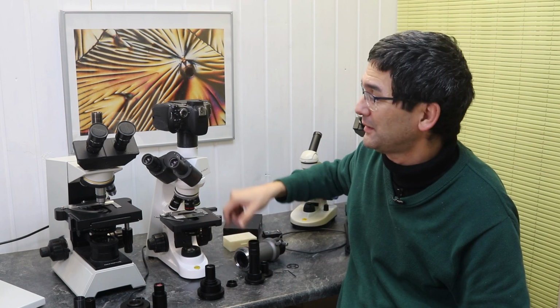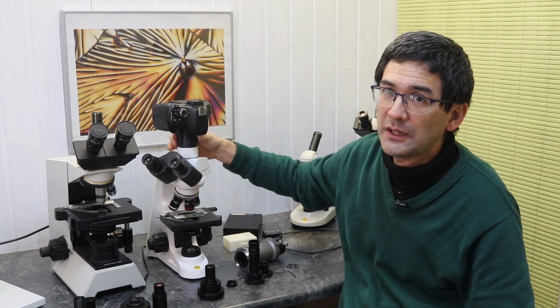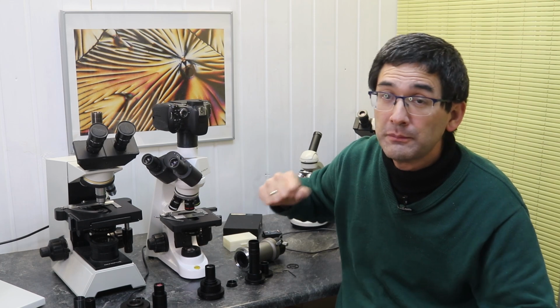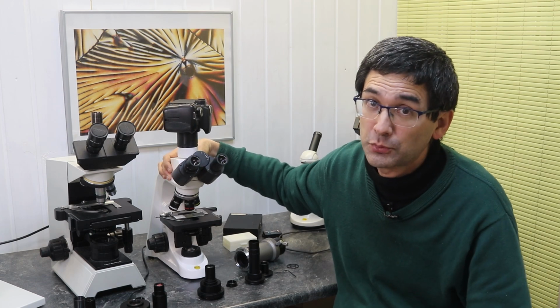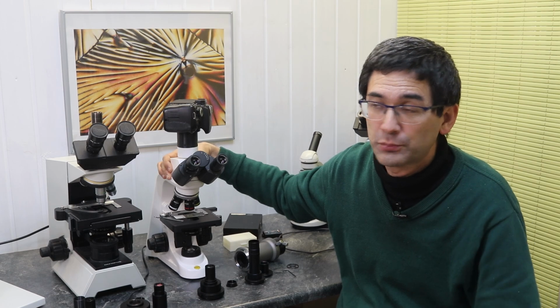and also nicer looking if you just have a short tube over here, which allows you to directly capture the image of the objective. Not all microscopes are that modular, however, and the one with the DSLR actually has an advantage. But again, I'm surprised that, considering it's such an easy solution, they don't just provide this tube.